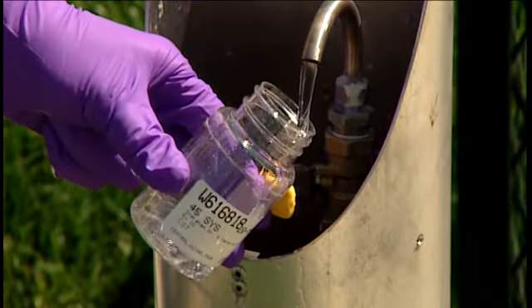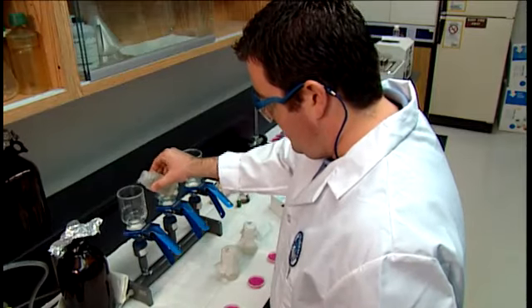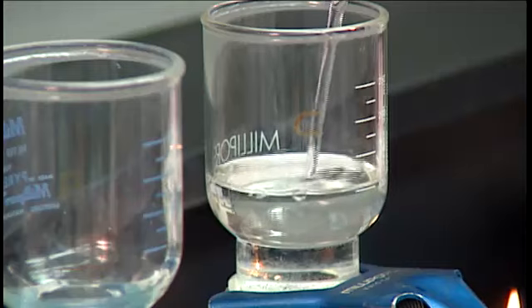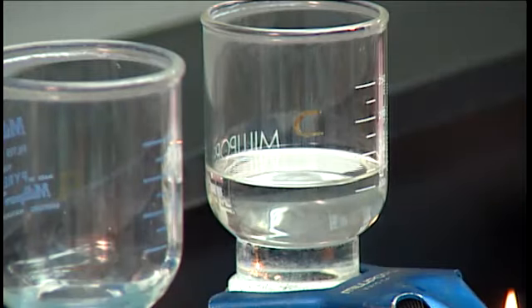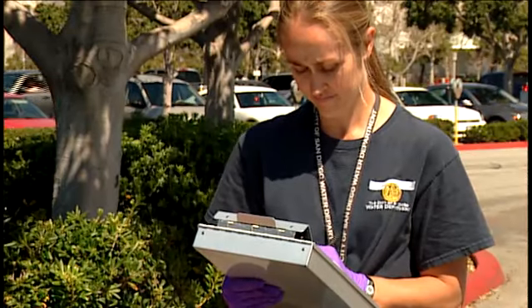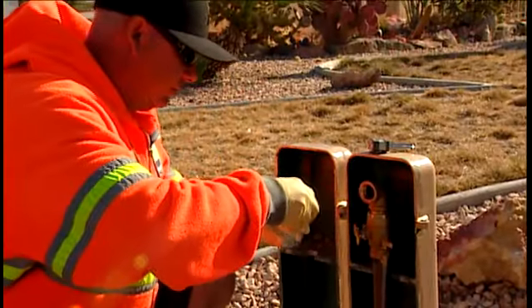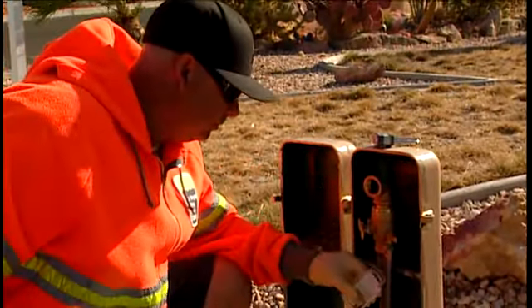Proper sampling and handling techniques and the use of a certified laboratory are required to accurately determine water quality. Proper collection techniques and reliable record-keeping are essential. Here are some general water sampling procedures that apply to most situations.